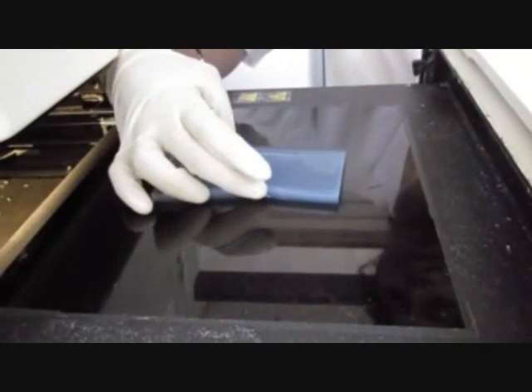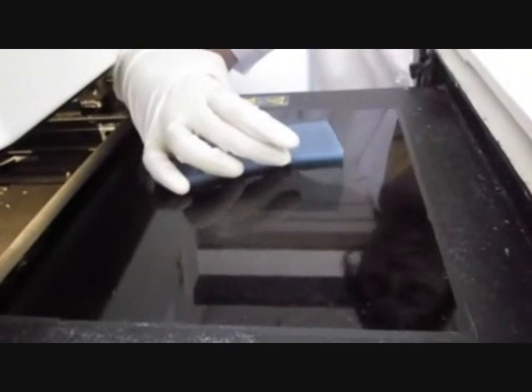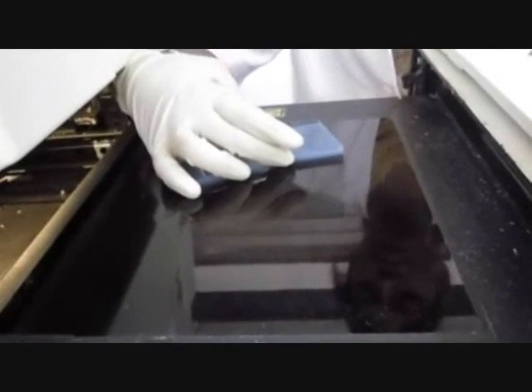The final step is the removal of the gel from the stage. This is done carefully by sliding the gel along the sides into the template, taking care not to break the gel.